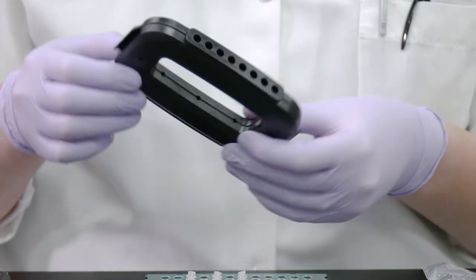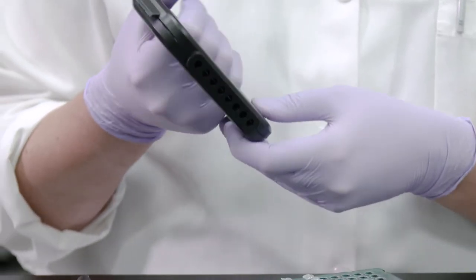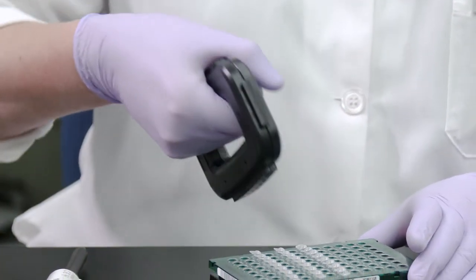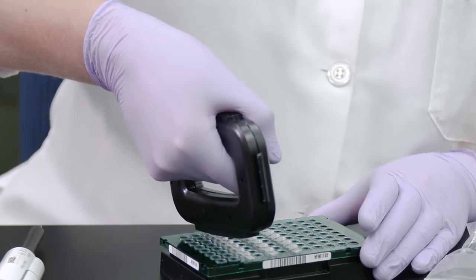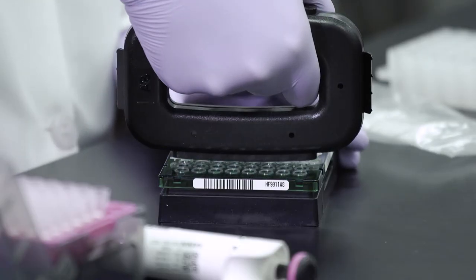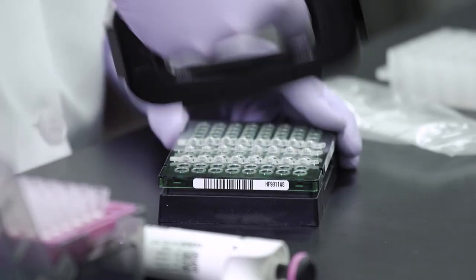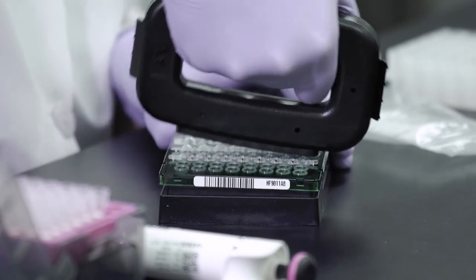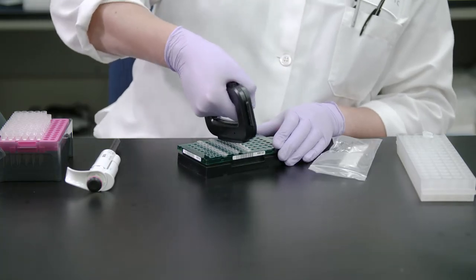First, slip your fingers through the handle with the holes in the tool facing down. Place the surface of the tool over the first eight caps of the strip and rock the tool back and forth to seal the caps over the wells. Repeat this step for additional cap strips as needed.